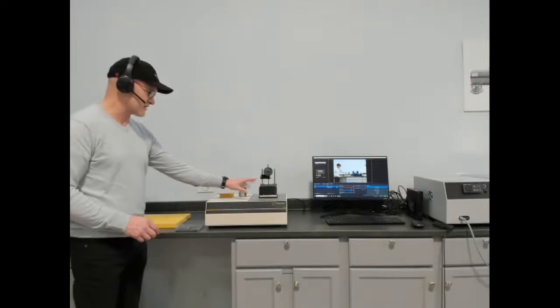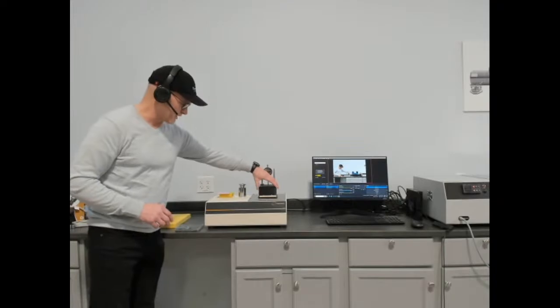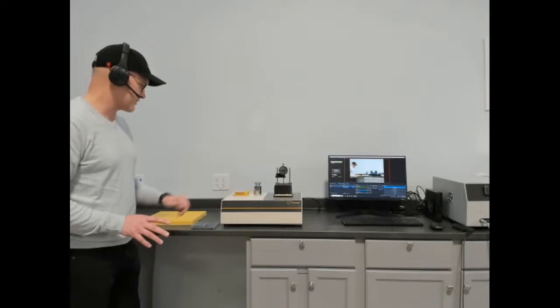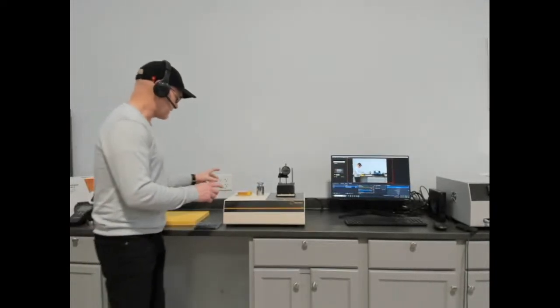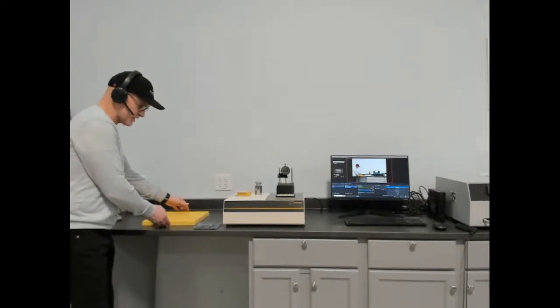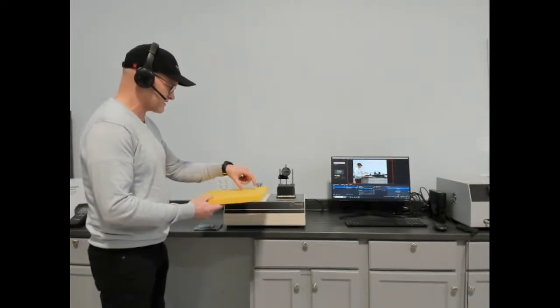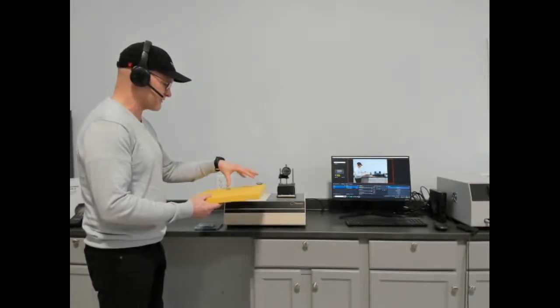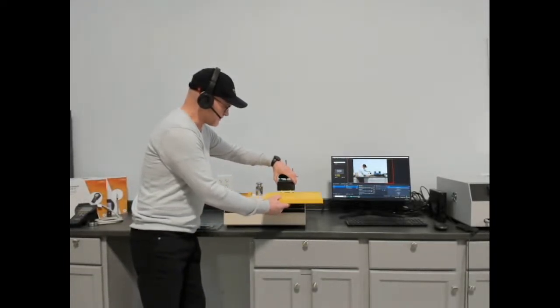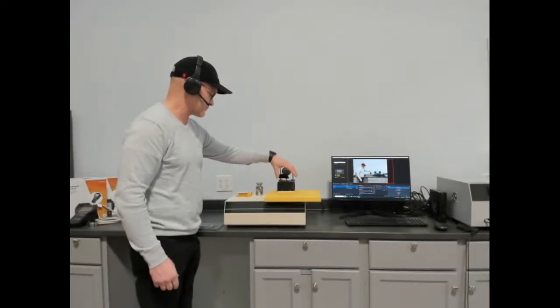So the maximum thickness on the HFM-25, again, the numbers after the hyphen, is 1 inch or 25 millimeters. It is manual open, and we'll talk about sort of how to set up a sample. Ideally, your samples are 2 inch, but of course you can do much larger than that. It is still only testing an active area of the 1 inch flux sensor plus the guarding of the material itself. But you're able to open the plates and insert samples that are much larger. You're just testing a much more localized spot.